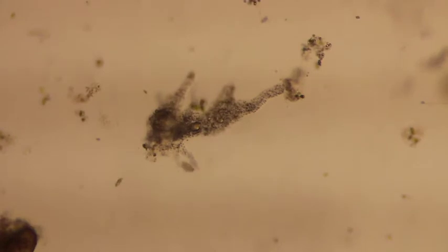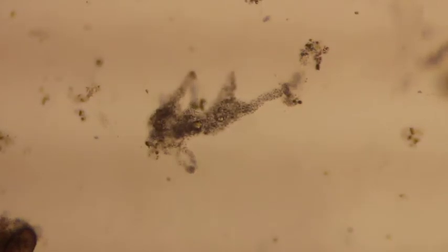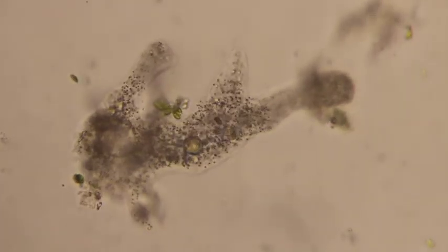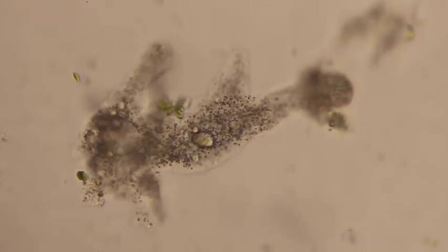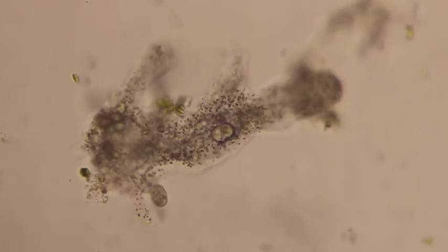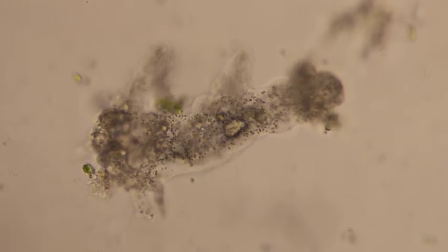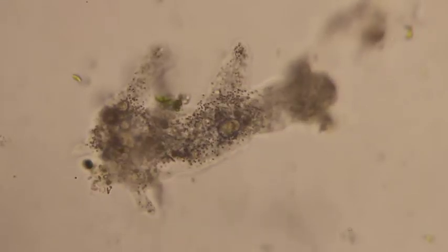These amoeba are eating what are called euglena. All these little guys swimming around are euglena. And what the amoeba does is that it tries to trap a euglena inside its long legs that it's moving around. Those long legs are called pseudopodia. And you can see right here that the amoeba is engulfing these little green guys. So they basically swim in, the amoeba attracts it in, surrounds it with its pseudopodia, and then ends up taking it into the cell.